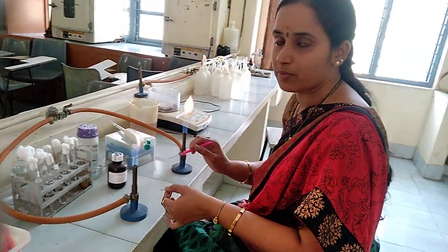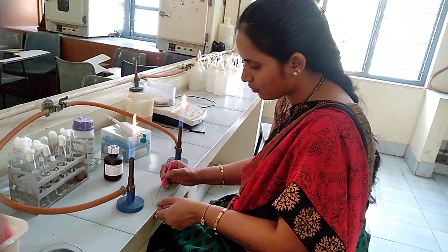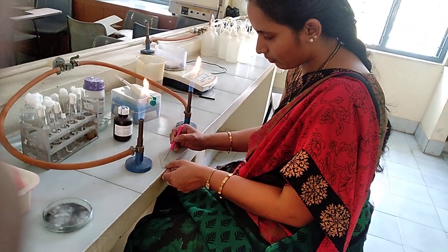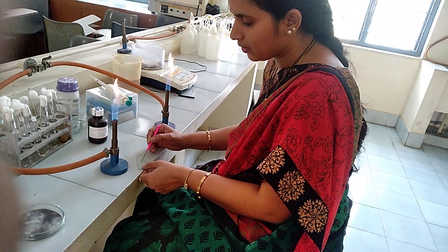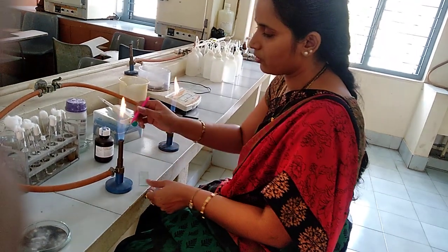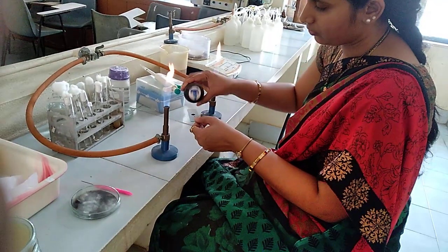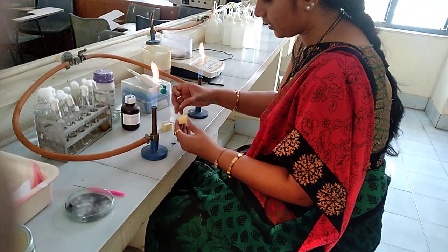Nicely tease it — we are separating the cottony growth, the mycelium, from each other so that we can observe it neatly when we observe under the microscope. After teasing the sample, add a drop of lacto-phenol cotton blue. Then you need to cover it with a cover slip — gently place the cover slip onto the sample.